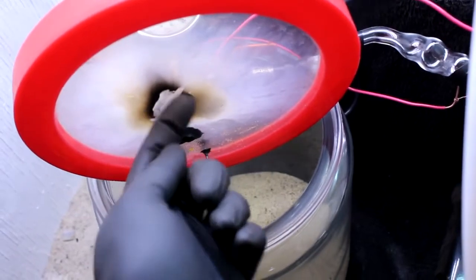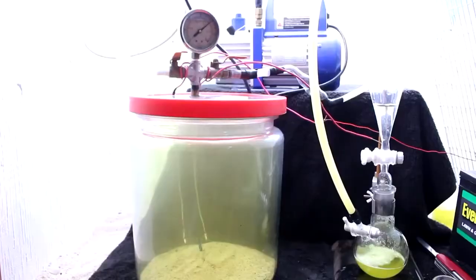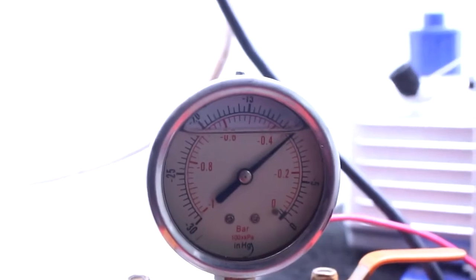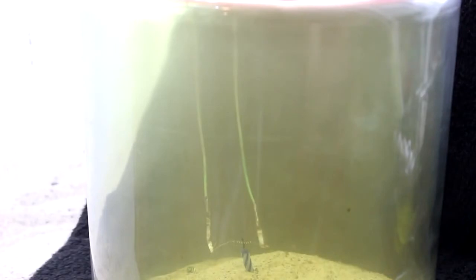That is significantly more chlorine. We're up to the 10-inch mark, so that's 16 inches worth. Ah, that's burning! I think it's interesting how the metal — my camera cut out there — but the metal was continuing to burn after the candle went out.